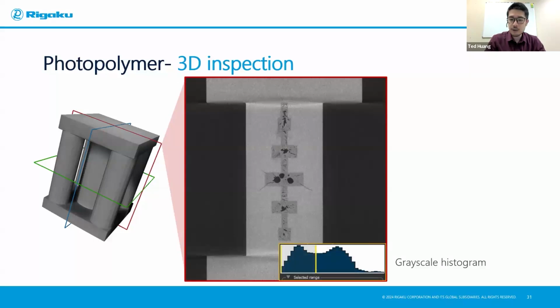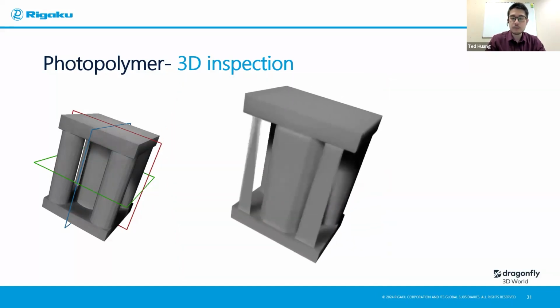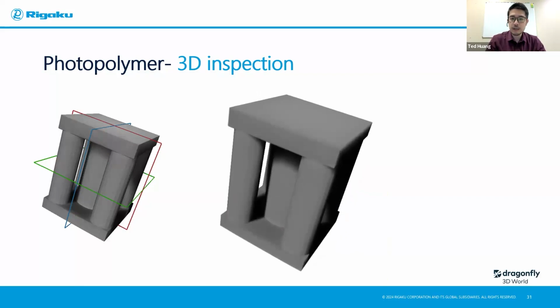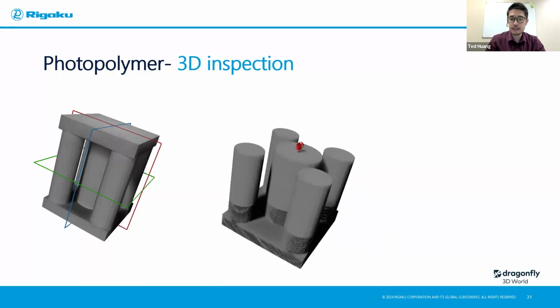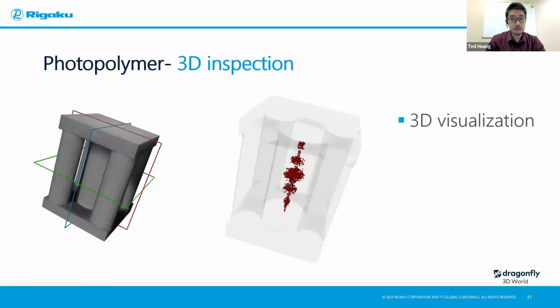Let's say I highlight all these pore areas because we have the contrast. In this case, the pores and the cracks are the darker peak, the left side peak you can see in a grayscale histogram. And let's highlight them, and say we do this throughout the whole volume, and then we can have a visualization of these cracks and pores inside this 3D printed product very easily and very intuitively, as you can see here. So already it's a very good 3D visualization tool to tell you exactly what's happening and where they're happening. We don't have to stop there.